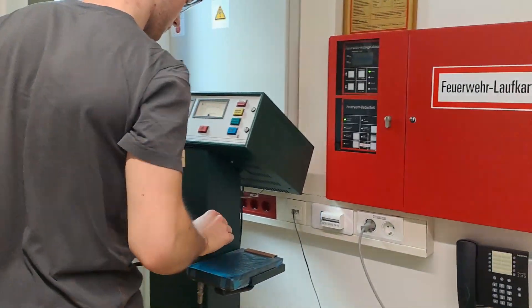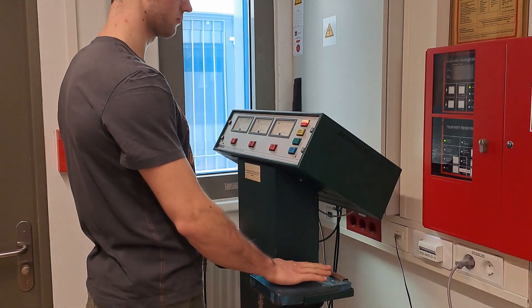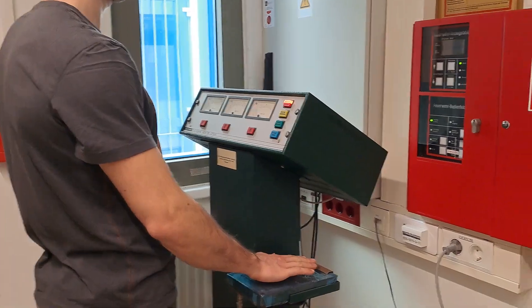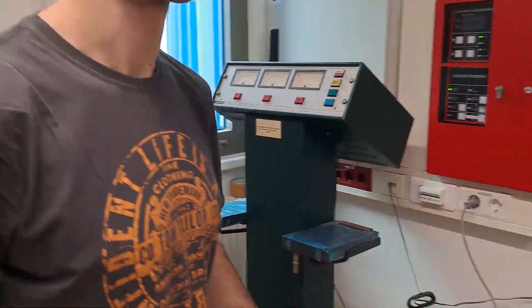This is another practical course tutorial, specifically for the experimental determination of the half-life of Barium-137M.